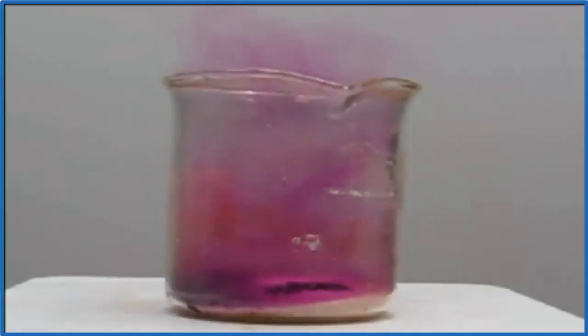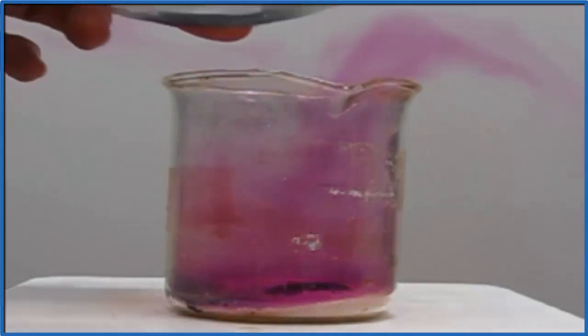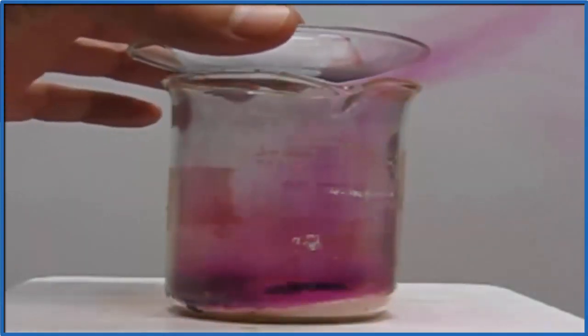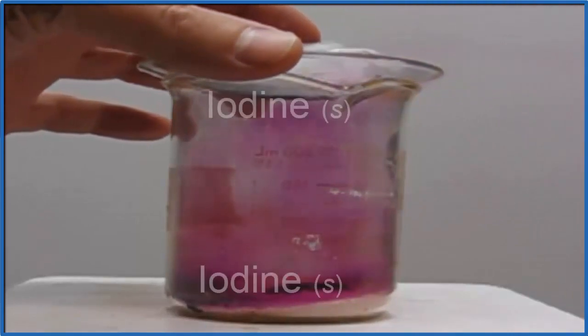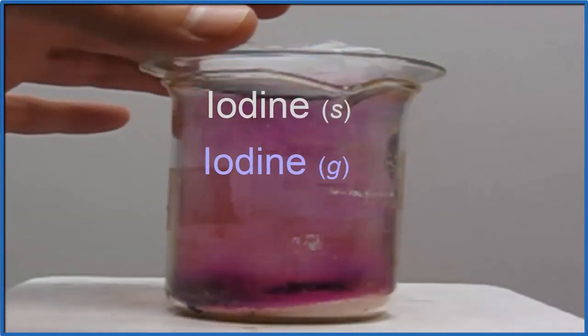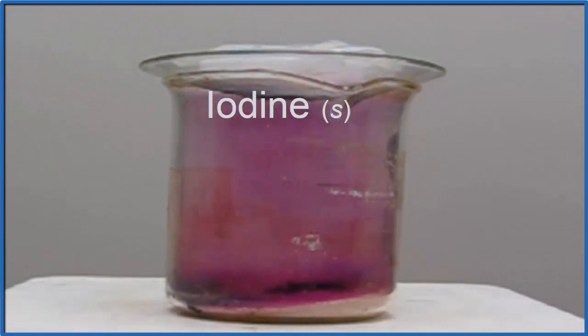But we can also change the gas directly back to a solid. So I have a watch glass over the beaker with ice on top. When the iodine gas hits the cold glass underneath, it changes back to a solid.